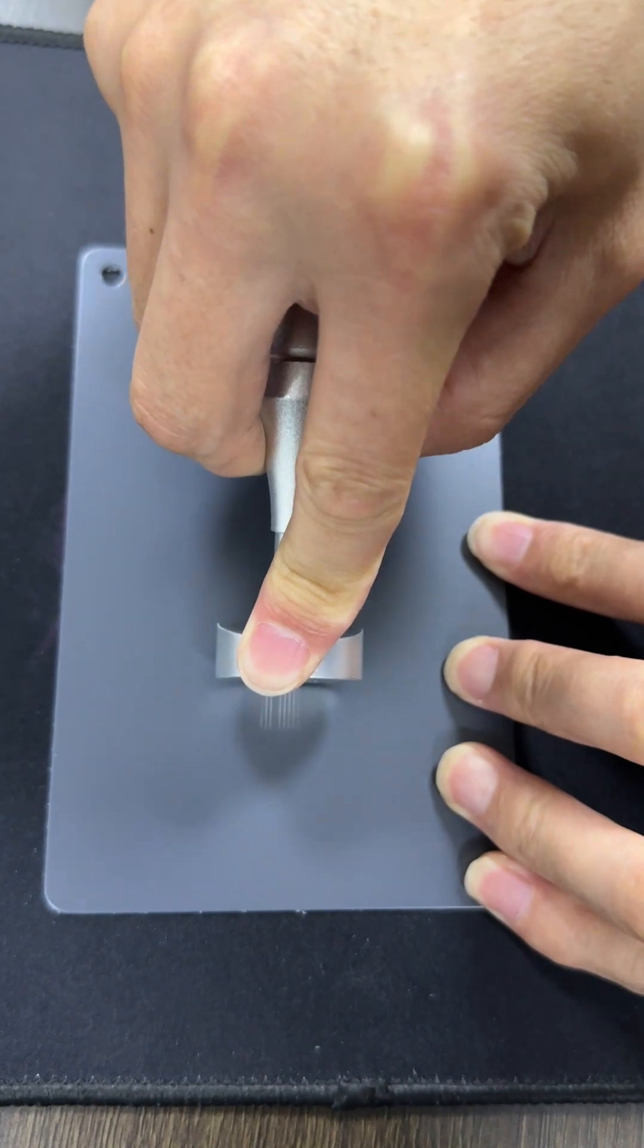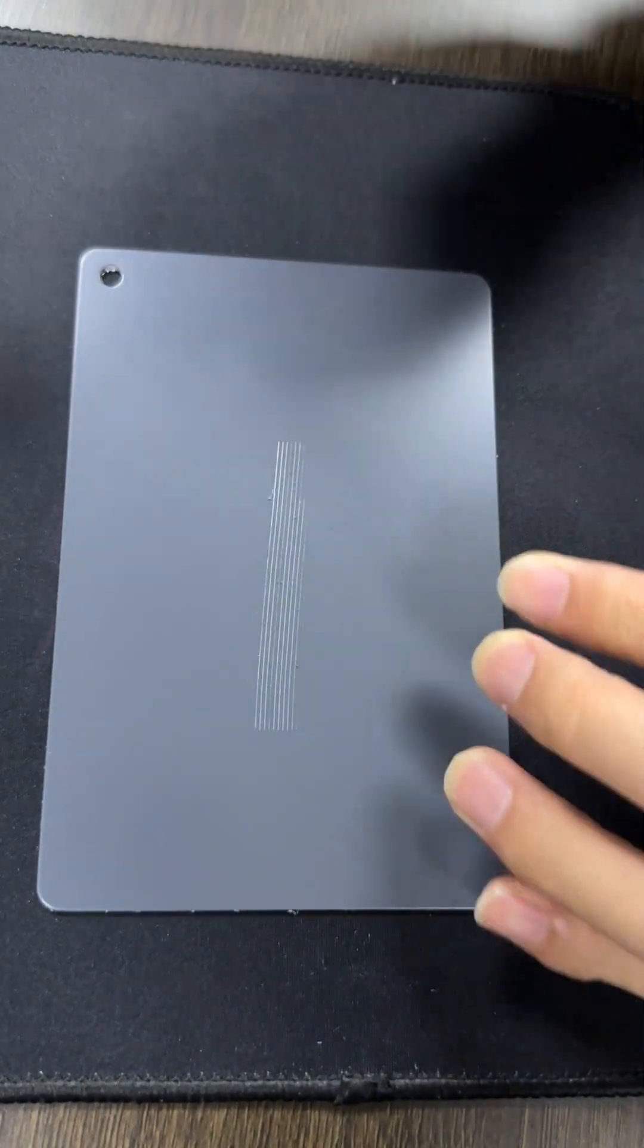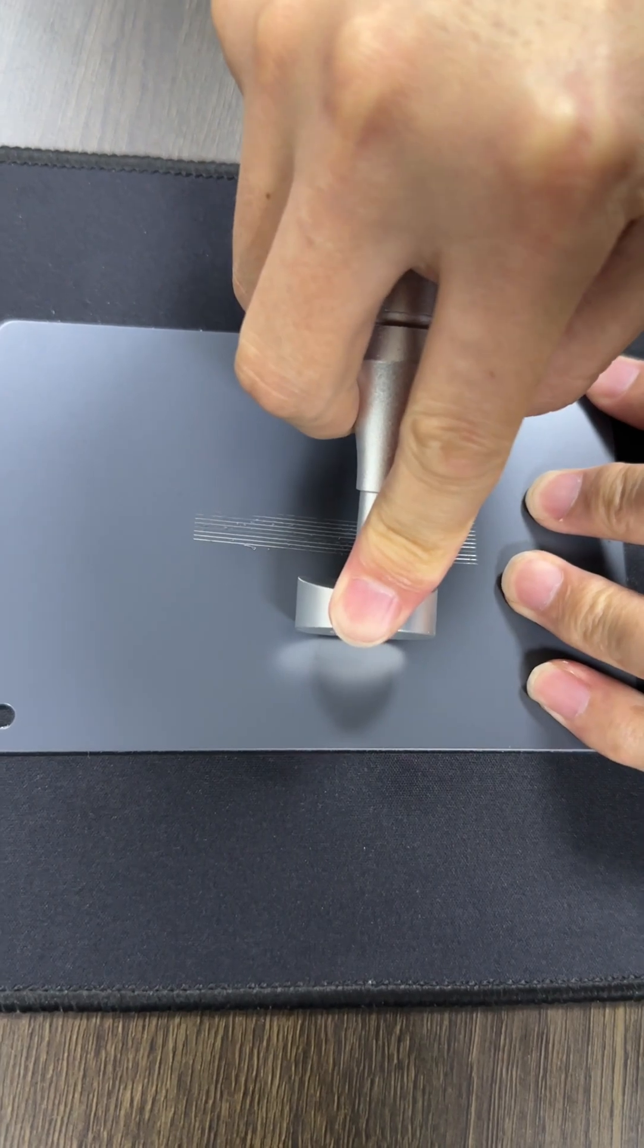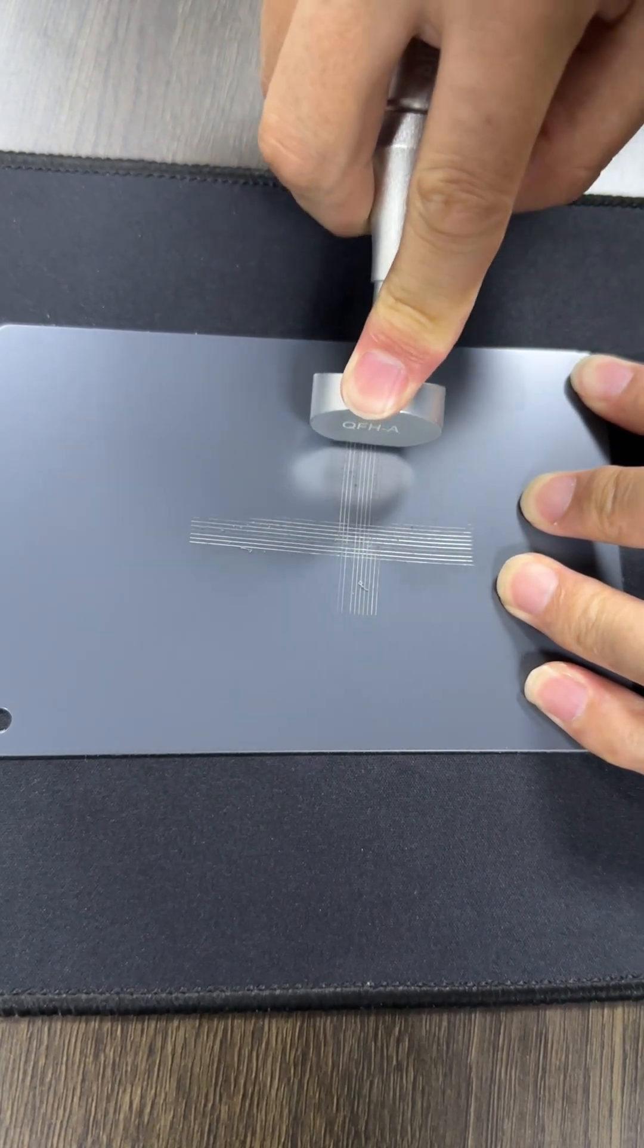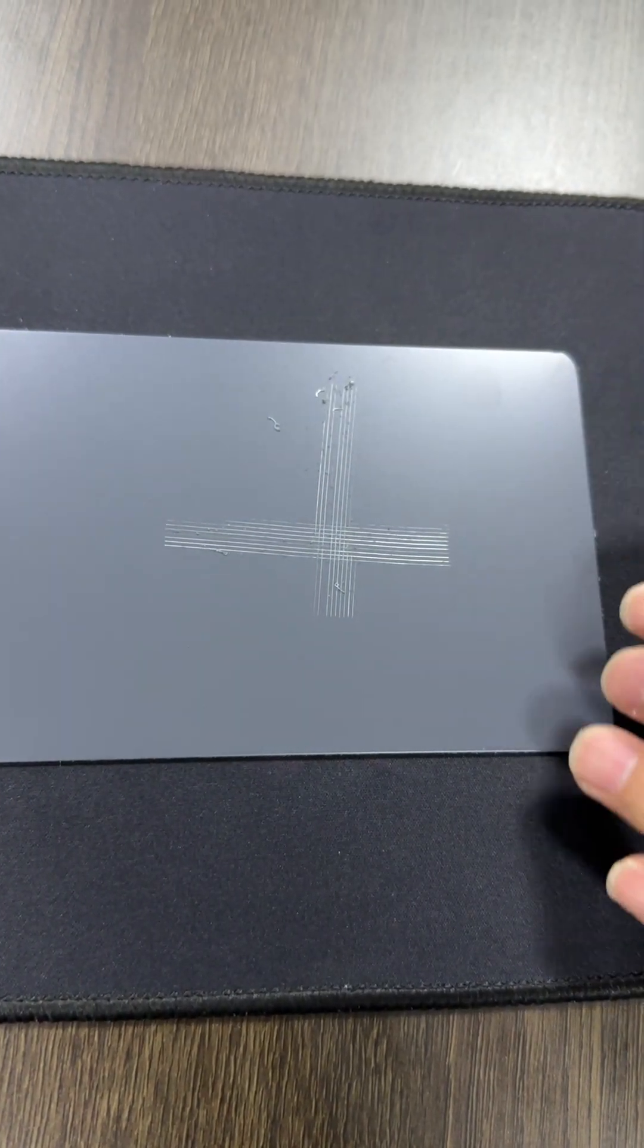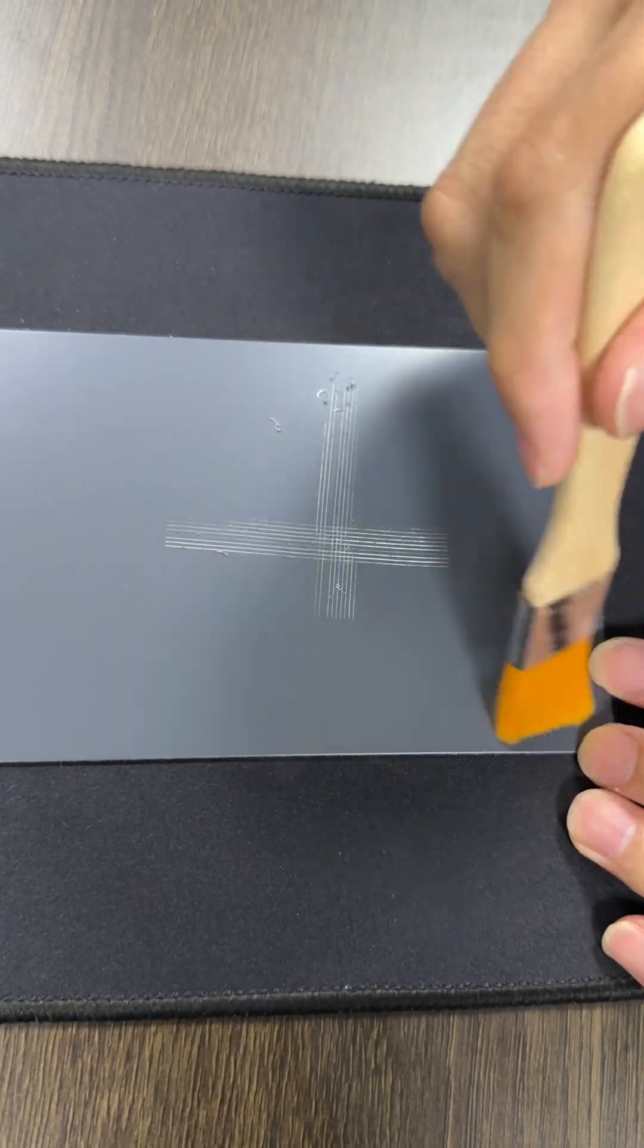First, make a cut in the cross-machine direction on the sheet sample. And the second will be in the machine direction on the sheet sample. That will generate a cross-hatch pattern with squares in it.